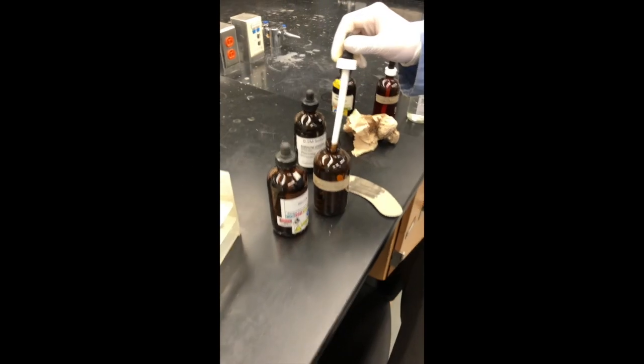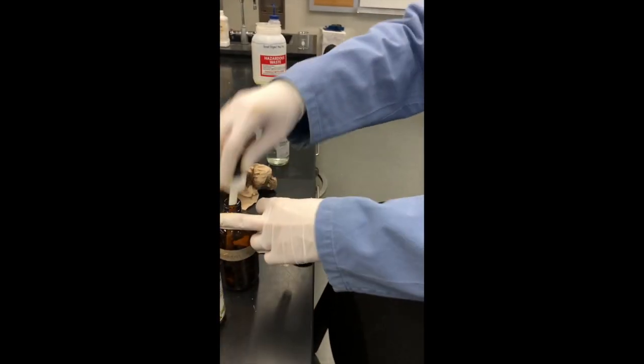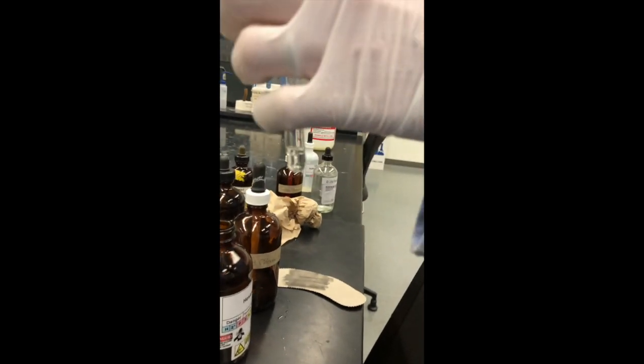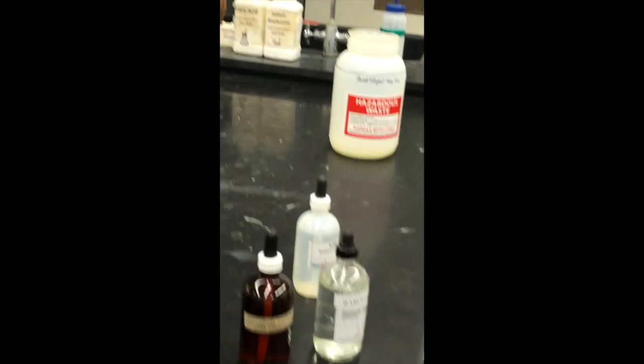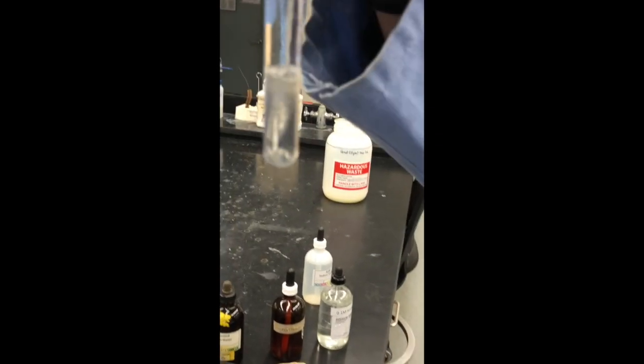We see right away there's a precipitate, so we go on to the anion test. We make up a solution of chlorine water with hexane and observe the two-layer system. Upon observing the color of the diatomic element in the upper layer, we then add our unknown and see if the upper layer changes color upon shaking. Looking at the upper layer color, we can determine if a reaction took place and identify the anion in our unknown.